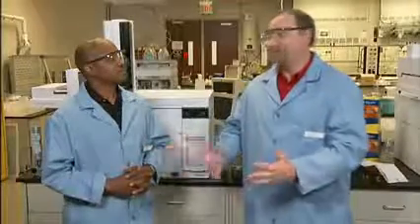Double check the concentration of the sample you prepared and correct if needed. Also, check for solvent compatibility. Check your purge time and make sure it hasn't changed. And finally, check all of your flows and temperature settings against your documentation. We're making our way through all these common GC troubleshooting issues that we see. Next, let's look at changes in peak size and loss of sensitivity. Lots to discuss there too. Okay, let's get to it.